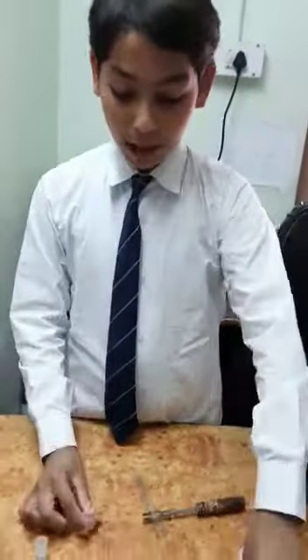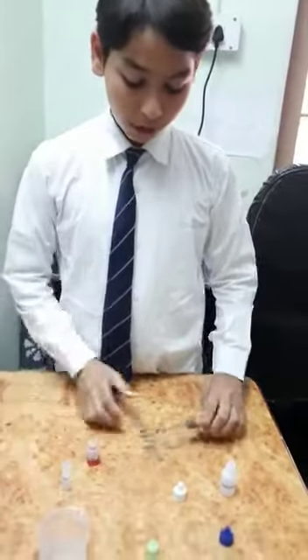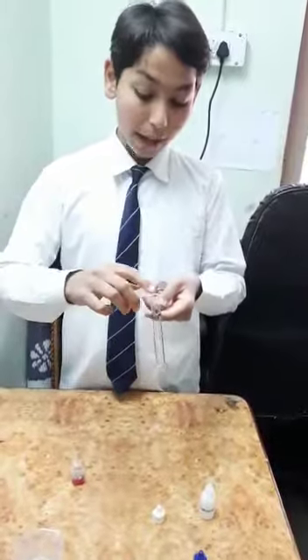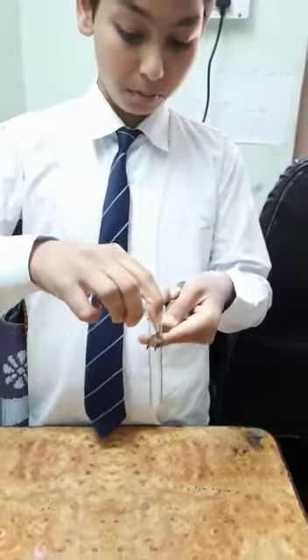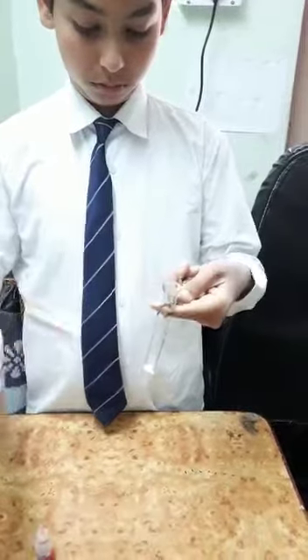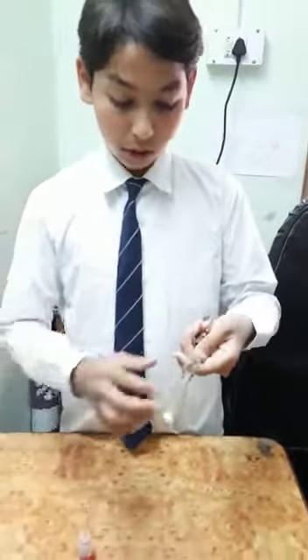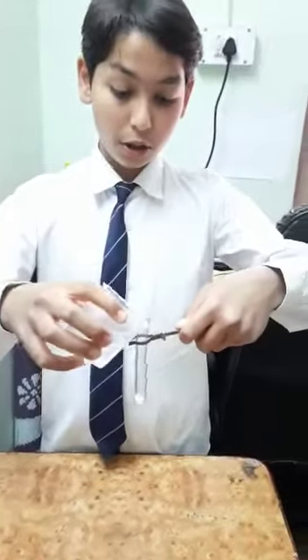We have methyl orange indicator, sodium bicarbonate, and H2O. So we are going to add some sodium bicarbonate and test it. Now we are going to pour H2O in it.